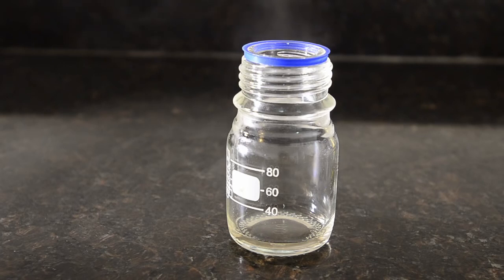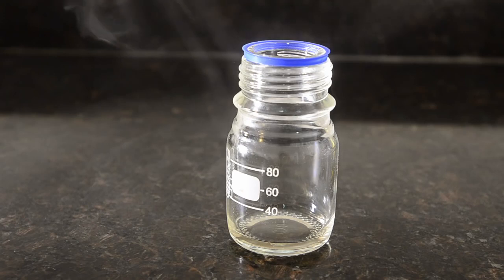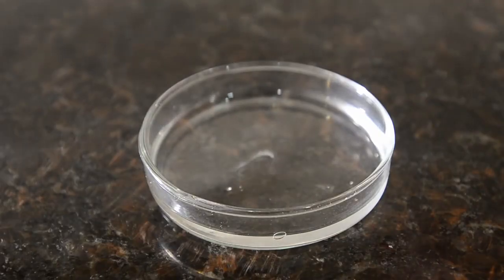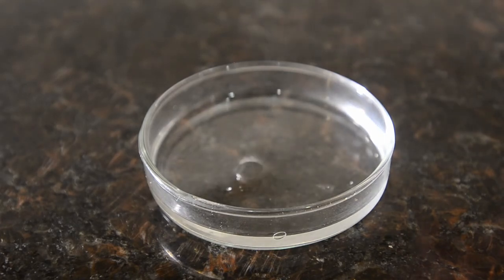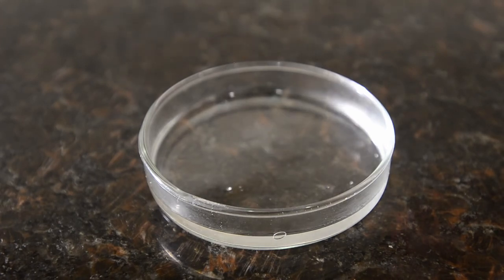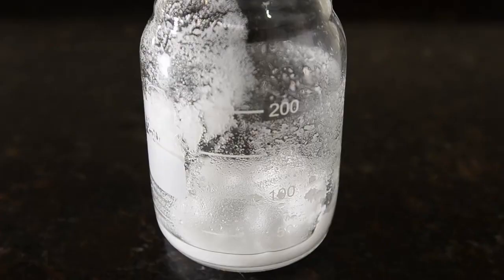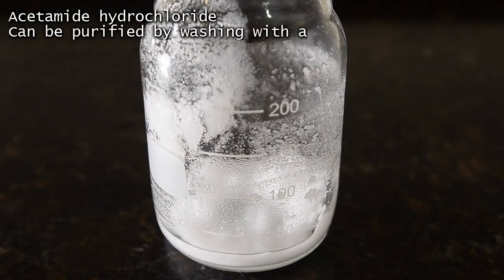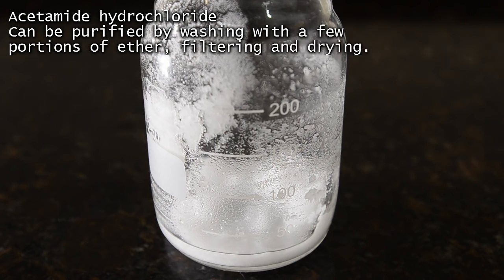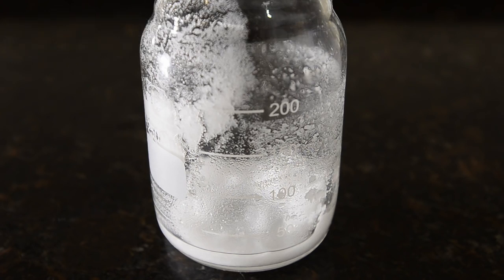As you can see, the product fumes very strongly in air. It reacts rapidly with water, producing clouds of HCl gas — no mistake, this is definitely the real deal. We also experimented and found that a small amount of ether could be used to wash the crystals and give us a pure acetamide hydrochloride product, which we'll use for another reaction.